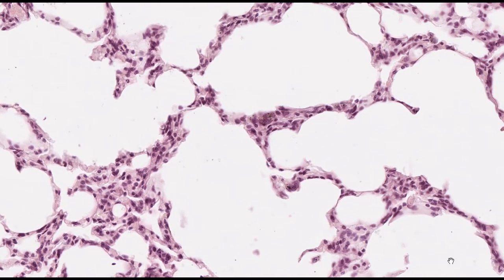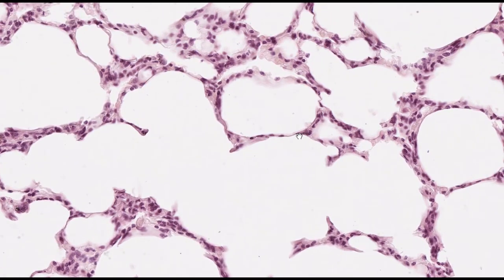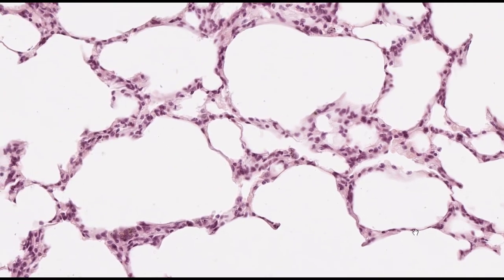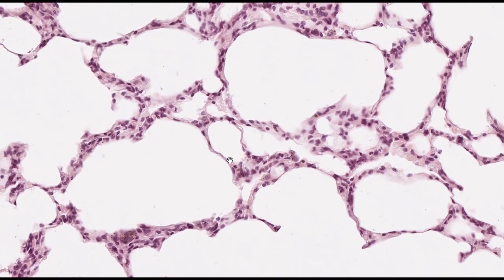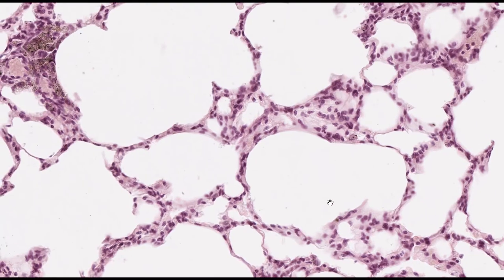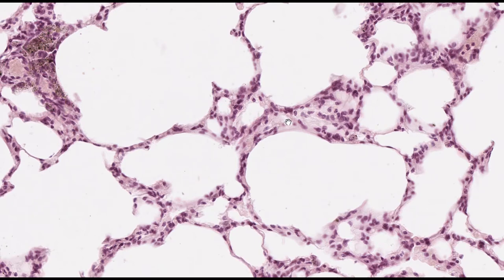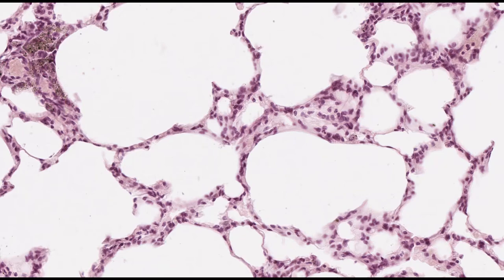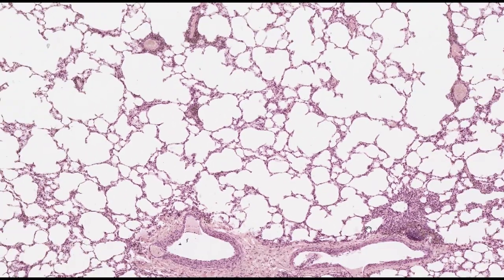So where in our body would we have so many spaces all lined with simple squamous epithelia with really thin connective tissue in between for gas exchange? This is the lung tissue. A healthy lung should have almost negligible connective tissue between the two lining epithelia where gas exchange occurs. We shouldn't see much cytoplasm or connective tissue in between the air spaces because that would indicate a pathological condition.